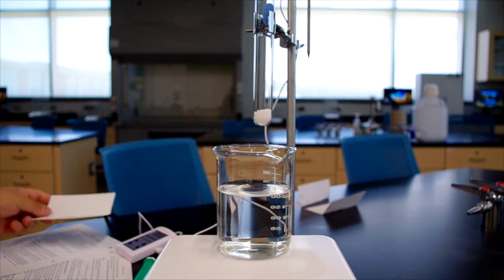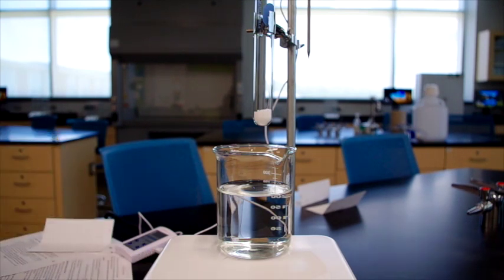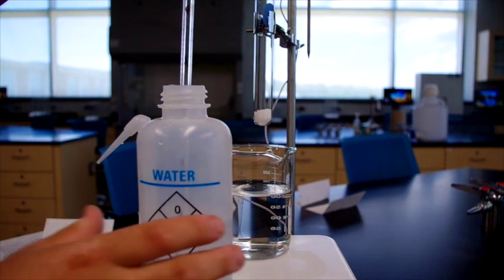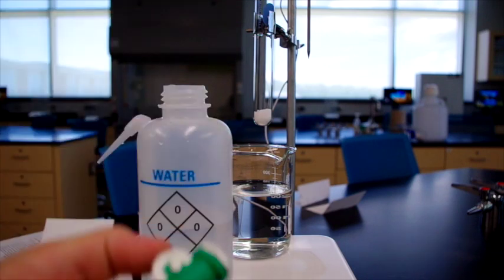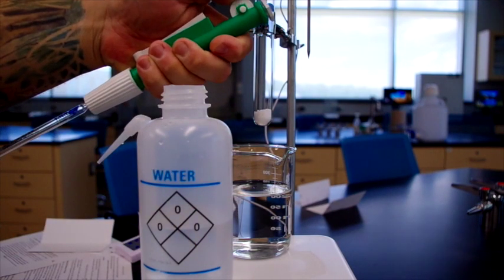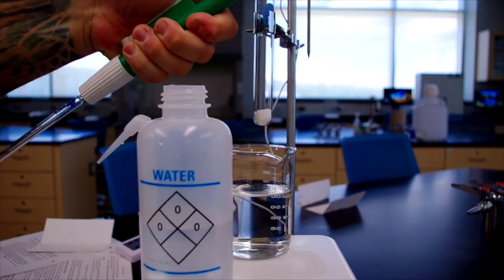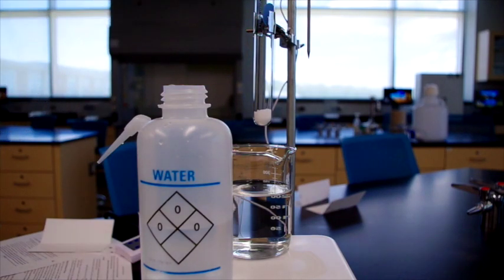There's our potassium nitrate, and then we are instructed to add 5 milliliters of water. I'm going to do so using something called a pipette, where it has a little crank on the side of it, where if you increase it, it acts like a syringe and pulls water into the pipette. This is a 5 milliliter pipette, so we'll fill it to the 0 line.